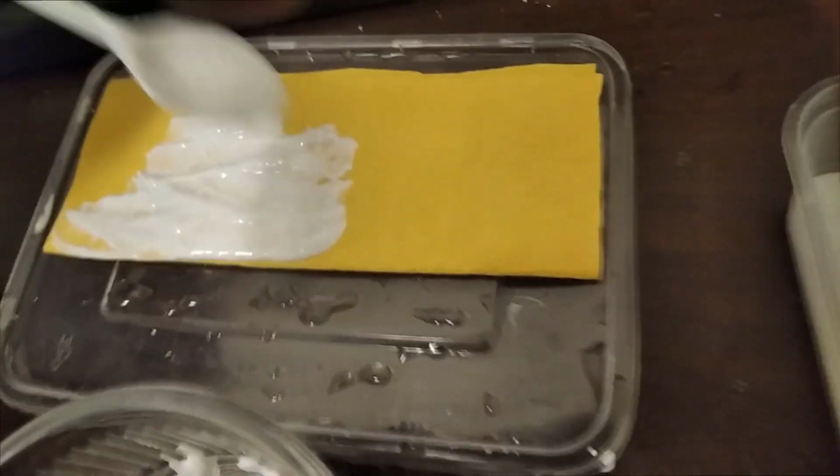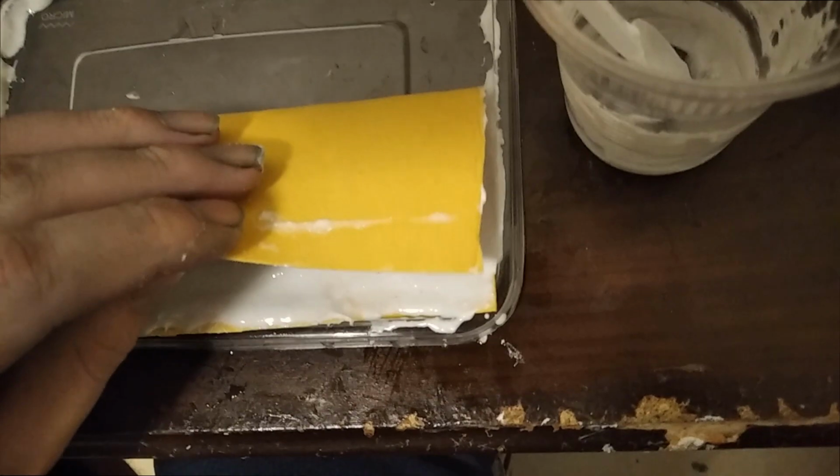I cannot paint this while holding hand. It's very difficult, so I will be back. After painting the surface, we then do something really important. We have to make the sandwich. We need these two glue layers to be together before the final processing.